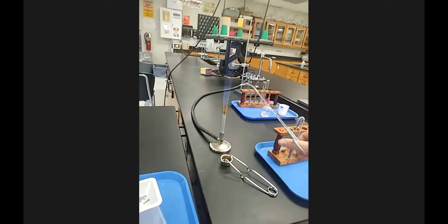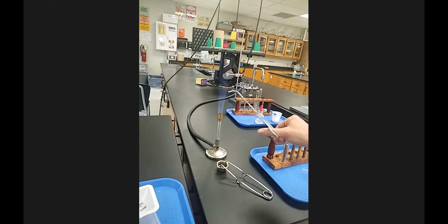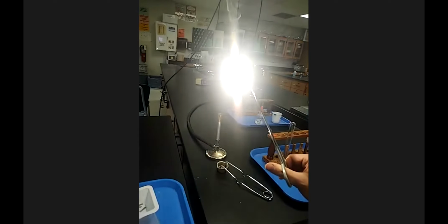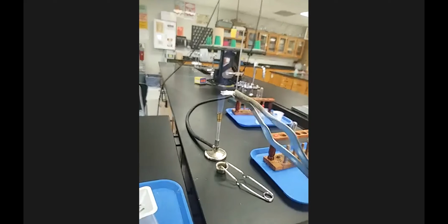Now, you guys are just going to view it. I'm not going to look at it directly once it starts going, but I'm going to do a small piece, not with the cobalt glass, and then I'm going to do the big piece. I'm not going to waste the big piece without the cobalt glass. So this is magnesium burning in the air there. Beautiful. Now, the after here.